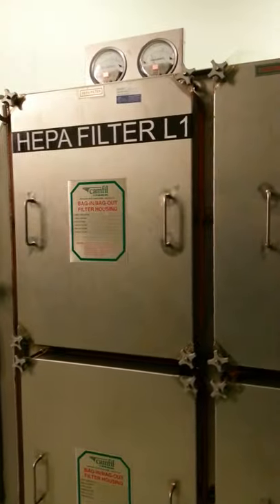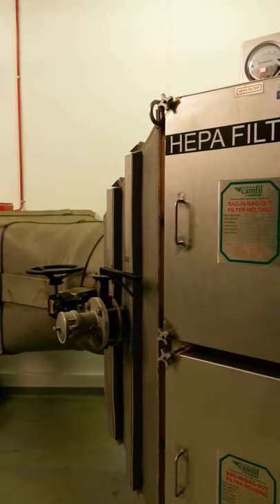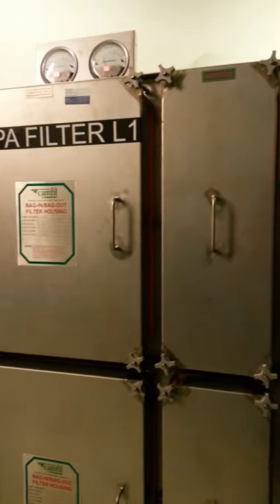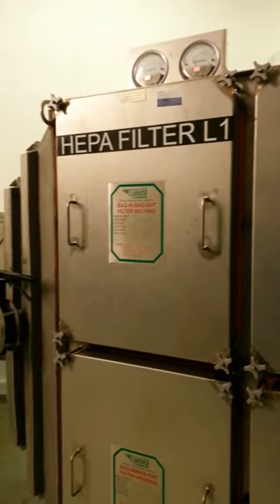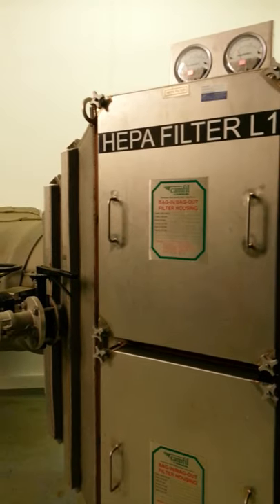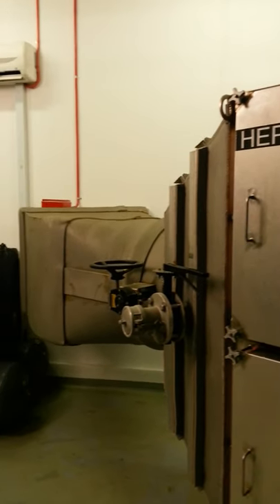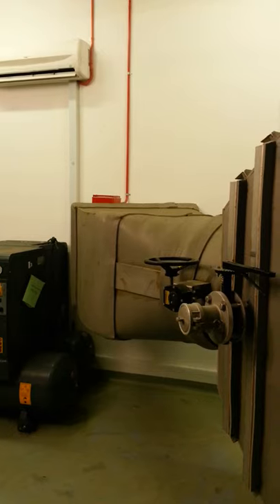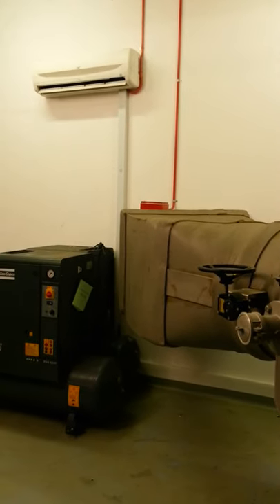This is another larger HEPA filter unit which is basically an exhaust unit, and it will filter out all the particulates from the air exiting this facility before it is released out into the environment.